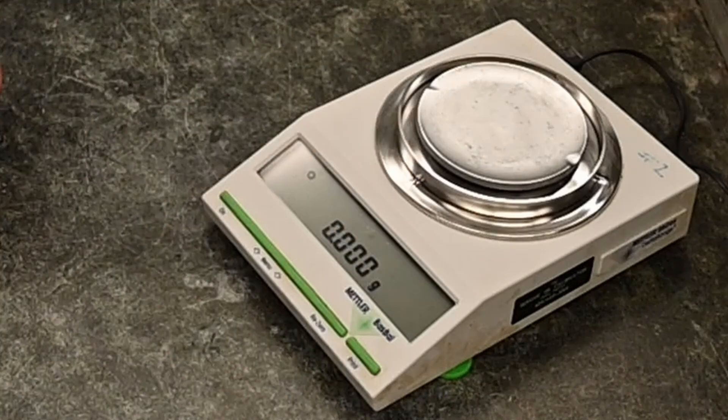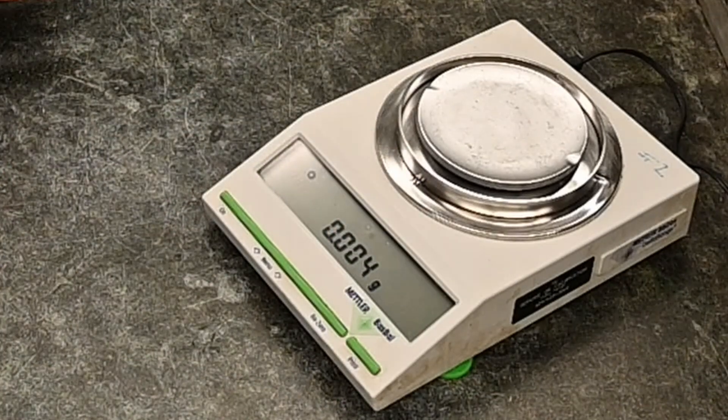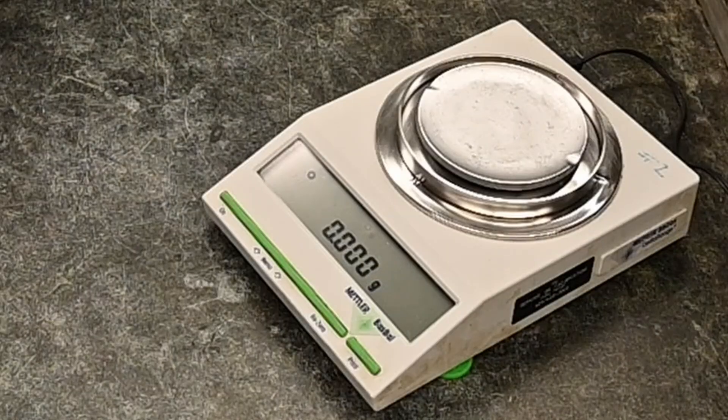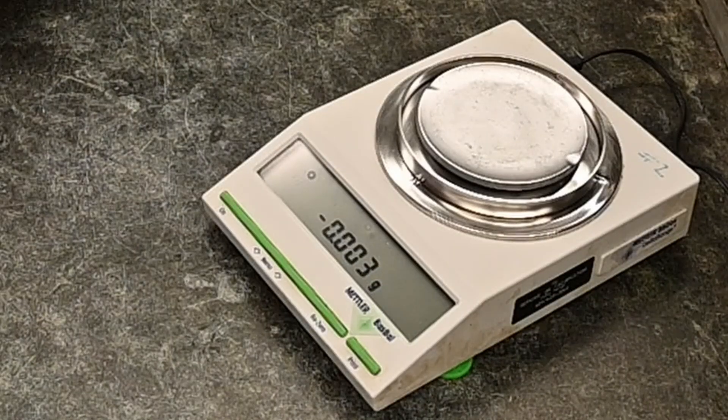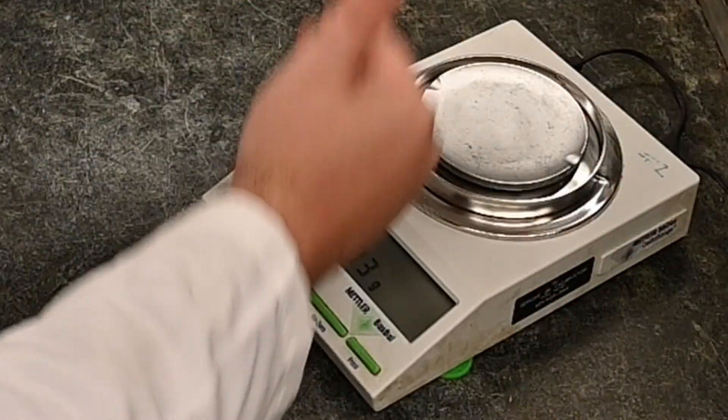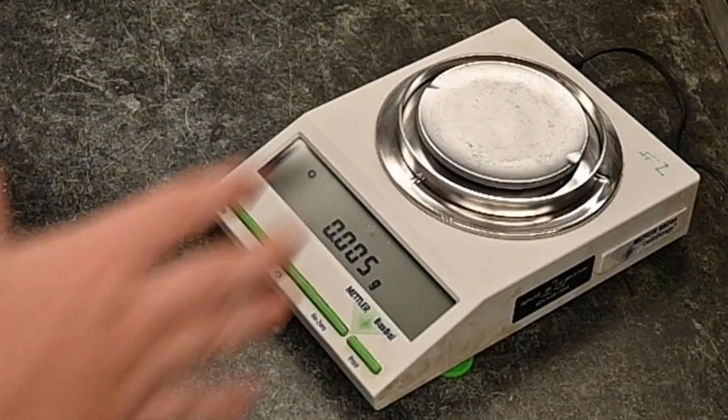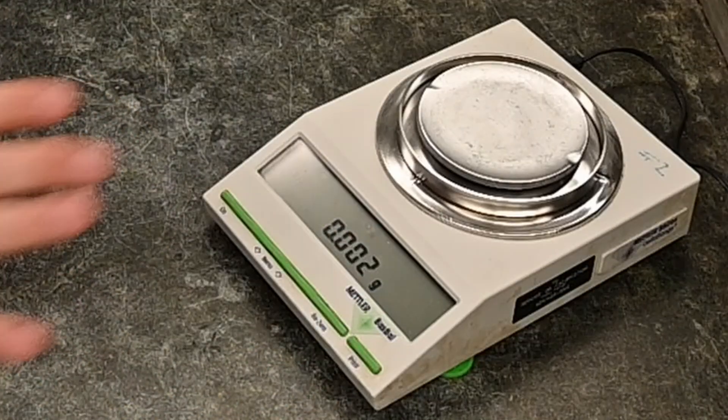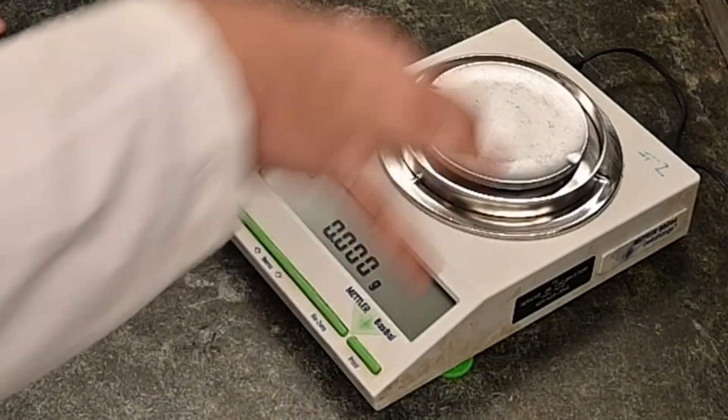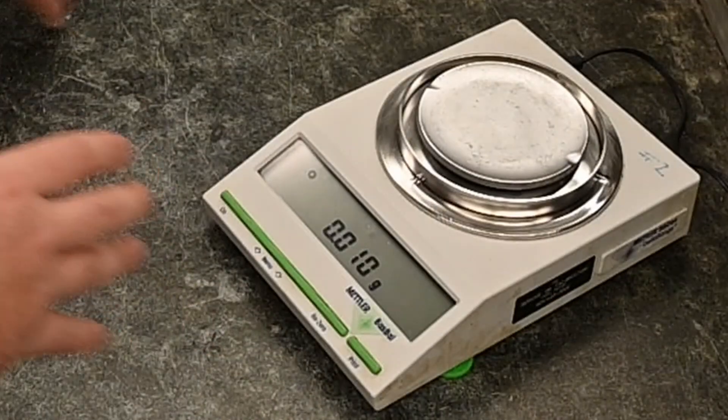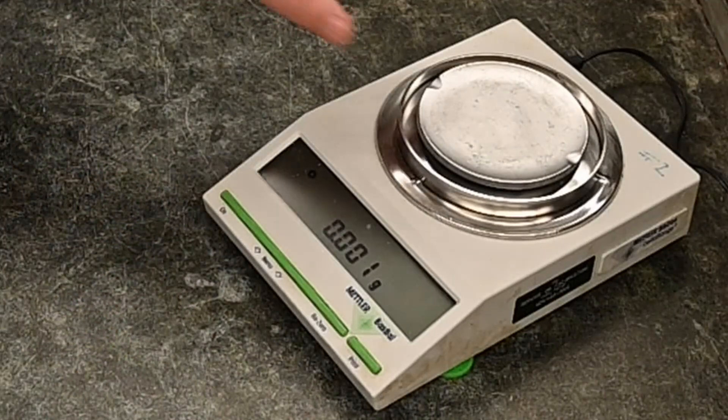So don't worry too much about that. But I've had students sit there and wait like a full minute for that thing to stop. It may not stop. Don't panic over that. That's one reason why I actually have the boxes around it is to prevent that from happening a little bit. So just be aware of that. That last number, don't worry too much about it. These are also a little more, even more sensitive than the other ones. So please be very careful with that.